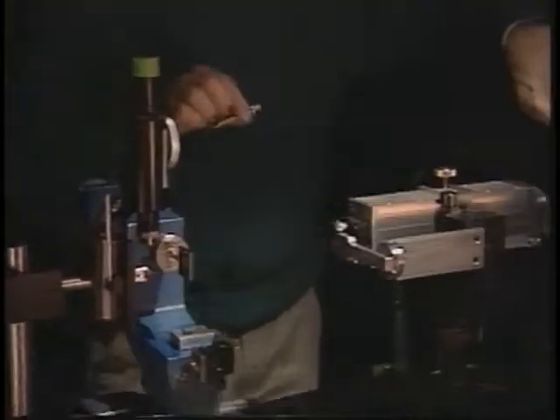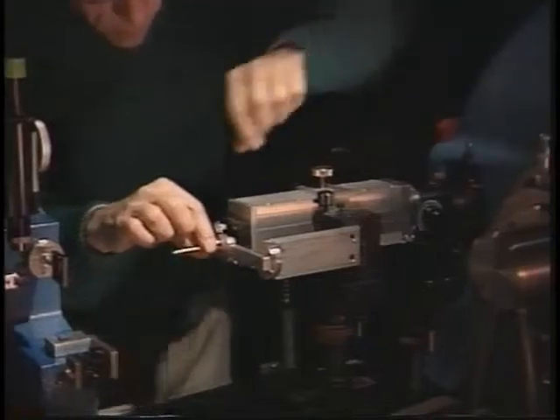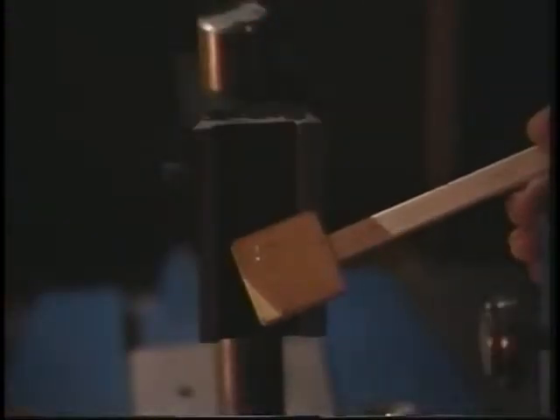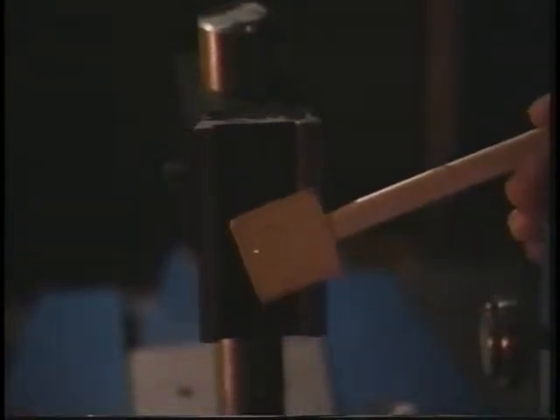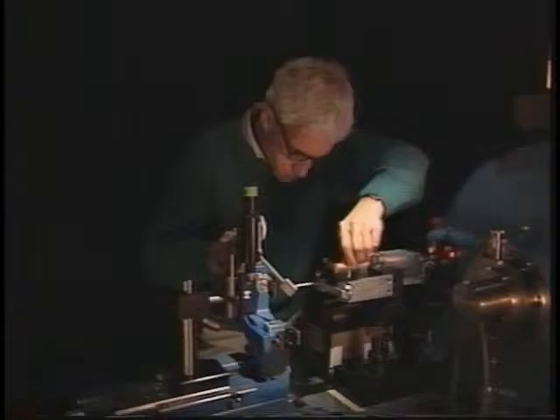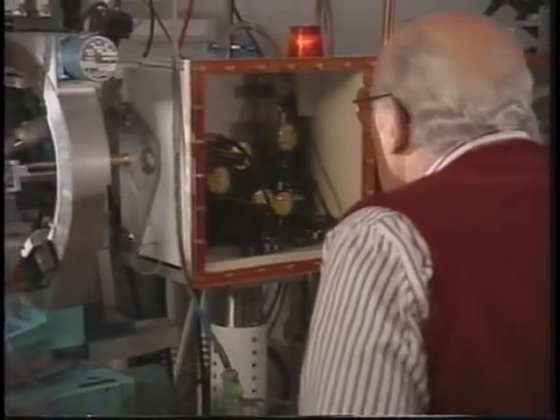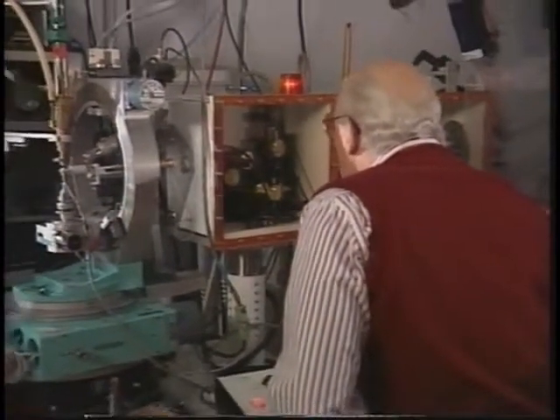Steve remains constantly aware of the on-off status of the X-ray beam. Whenever placing his hands close to its path, he repeatedly verifies that the shutter is closed. This discipline is never compromised, even though warning lights alert him when X-rays are being generated and when the shutter is open. Aligning the X-ray beam is best undertaken by a skilled worker. Doing it properly requires complete concentration. Newer X-ray machines are aligned by remote control, keeping the operator at a safe distance from the beam.